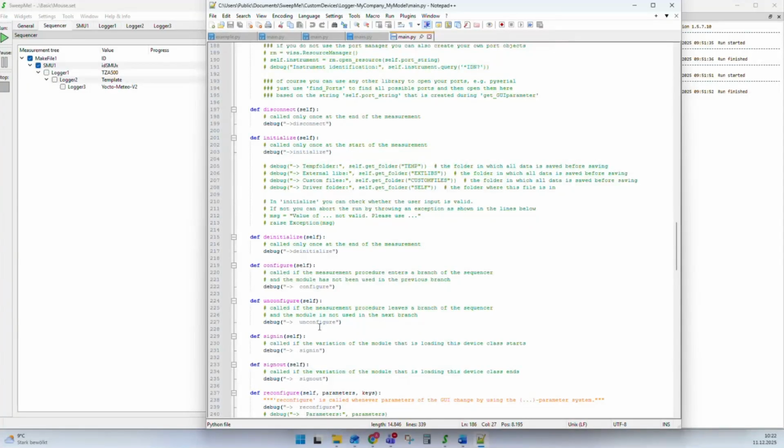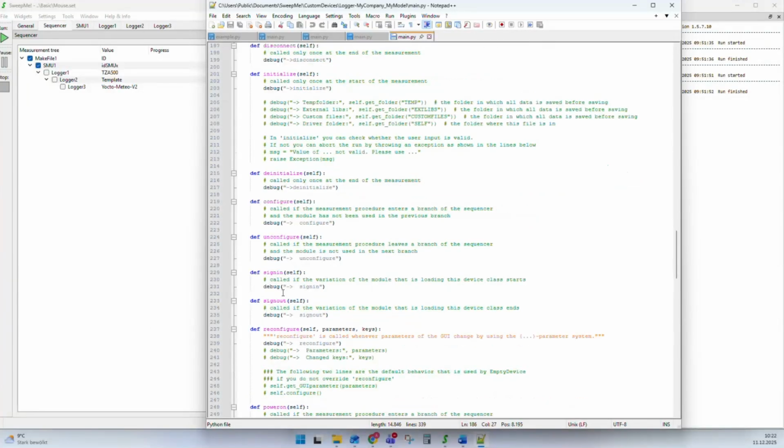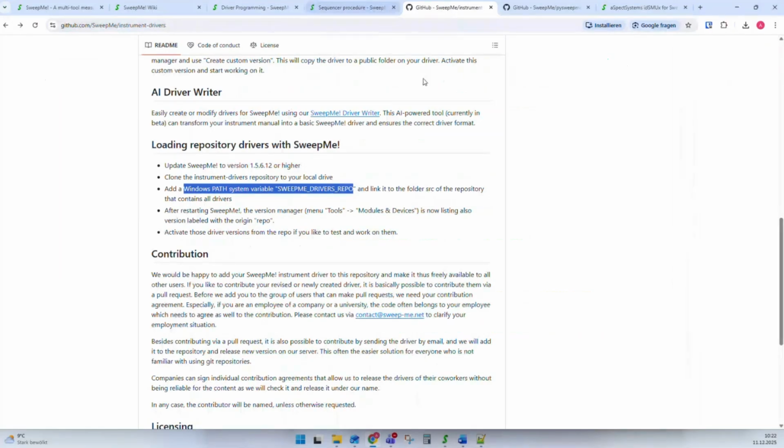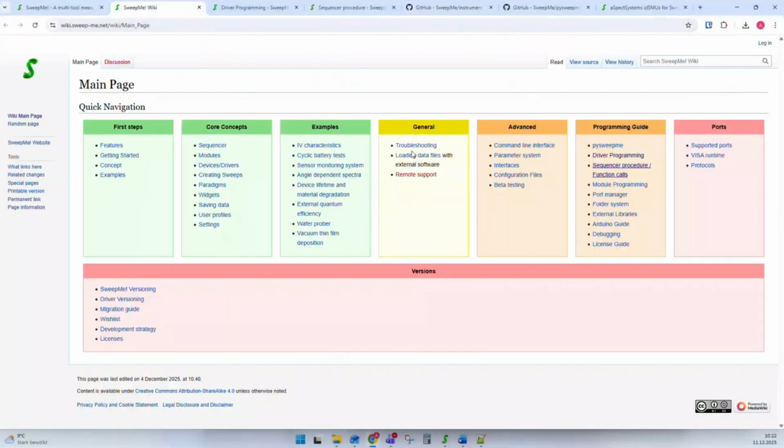And this also means that when we have multiple drivers, SweepMe can call these functions from each driver and make sure all instruments are initialized, all instruments are configured, and so on. And this is why all the instrument drivers in SweepMe can immediately be combined with each other without having tested this beforehand. And to get an overview of all these semantic functions that you are allowed to use in the code, you can go to our webpage or use the button F1 and you come to our wiki.